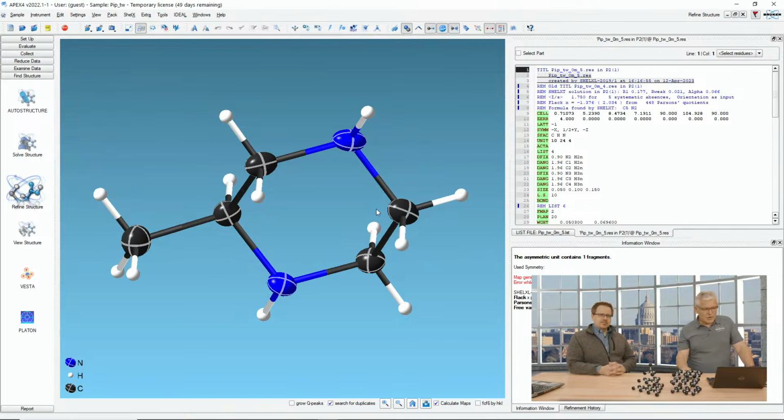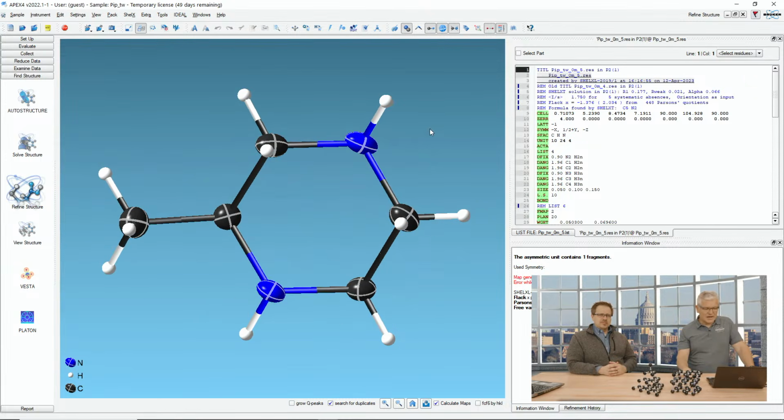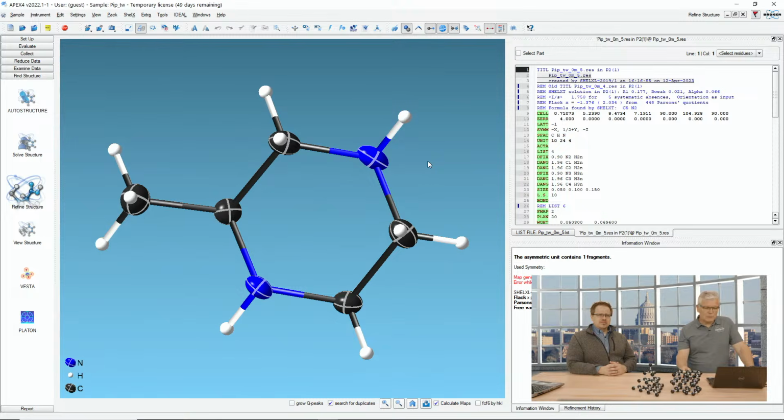So this is APEX4, and it's already started up. And what I display here is methylpiperazine. It's a nice little small molecule. And fortunately or unfortunately, most of those crystals are twinned. And they're twinned, again, in a symmetrical way.